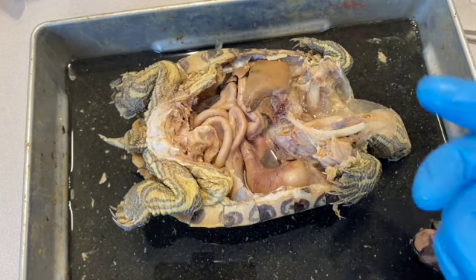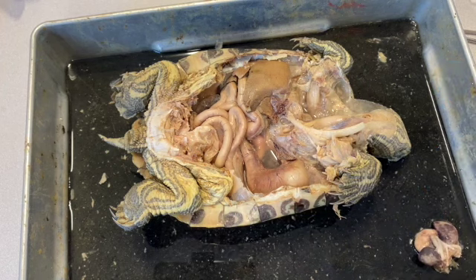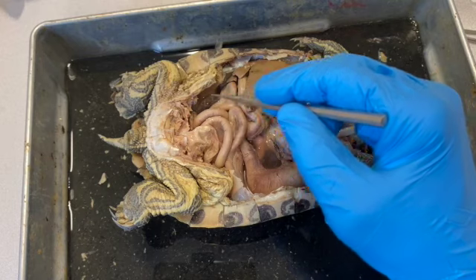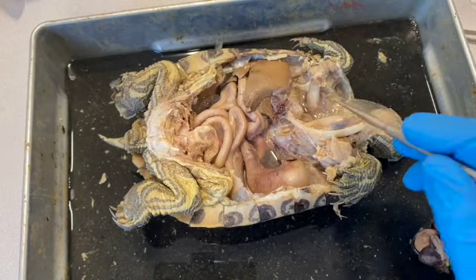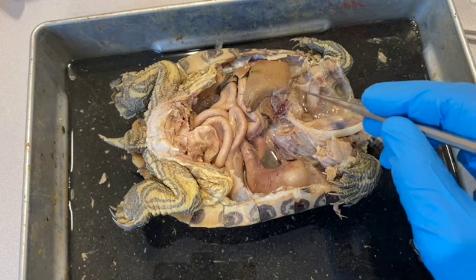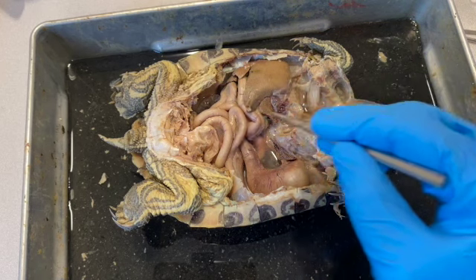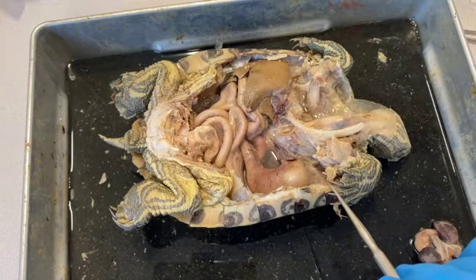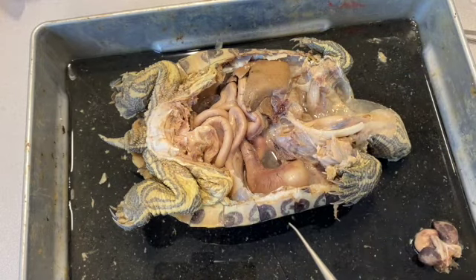The lungs are very large structures. Hopefully you saw the lung inflating as far down as this part of the abdominal cavity. The lungs are large organs that are dorsal along the inner surface of the carapace, about this big. And so anyway, we'll uncover those later on, but I wanted you to see that before we went any further.